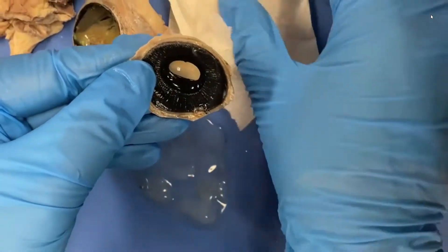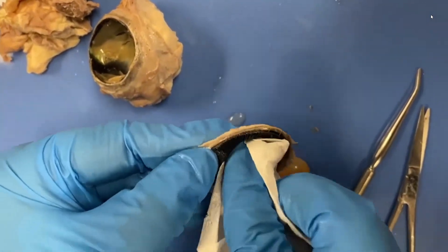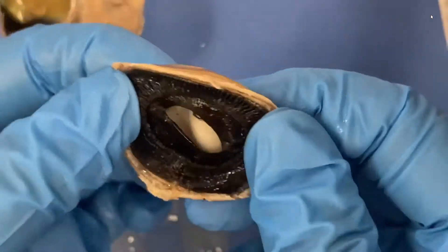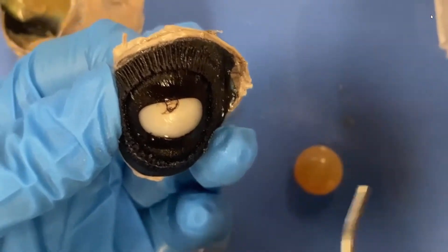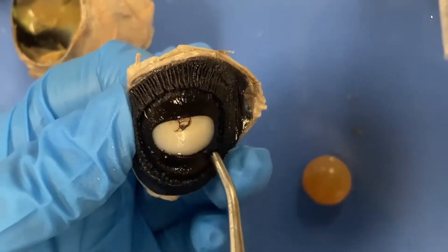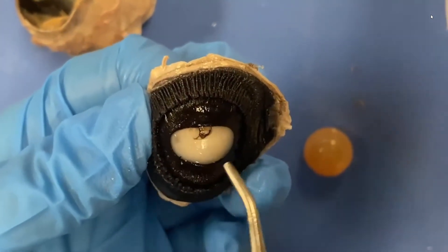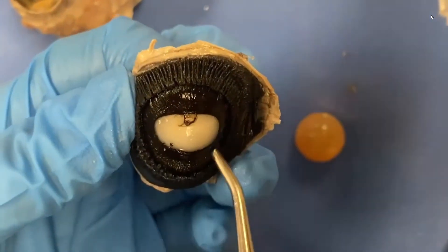So making that hole is the iris — this part right here is the iris. And if we look really, really close, we might be able to see the two muscles that make up the iris. Let's flip it inside out and see what we can see. Yes, we can. So the iris is composed of a sphincter muscle that is the internal one — that's this one right here. If you notice, the fibers are going around. So this is the pupil constrictor muscle, because when it contracts, it will make the pupil smaller. And that is controlled by part of the autonomic system — which part do you think it is?